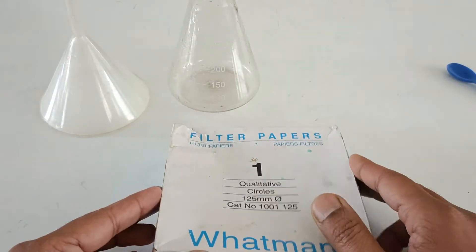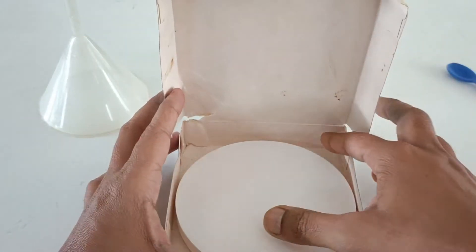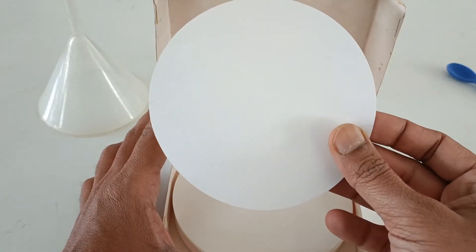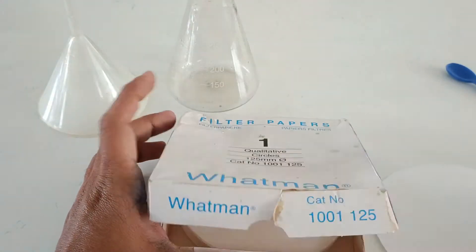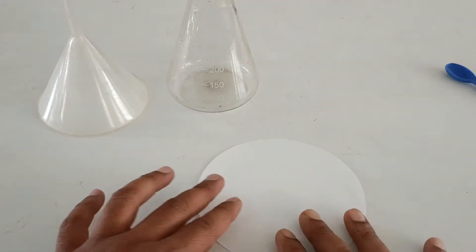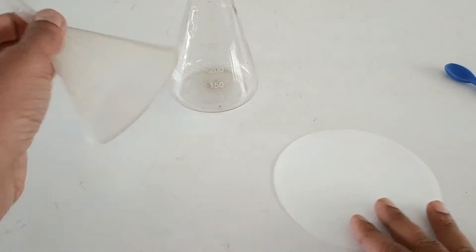This is a filter paper already cut in circular shape. Small invisible holes present on the filter paper will only allow liquids and solids soluble in liquids to pass through it.